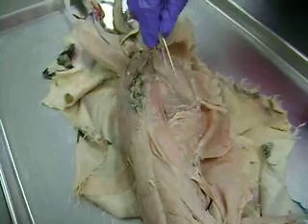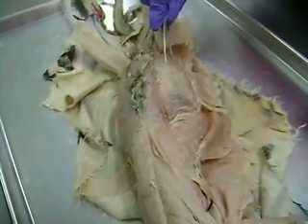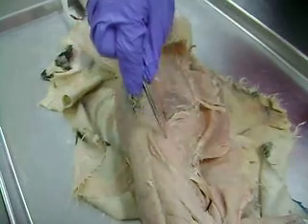Pull that back, and the layer underneath it is transversus abdominis, or the transverse abdominis. And then the one that comes down the middle here is called rectus abdominis.